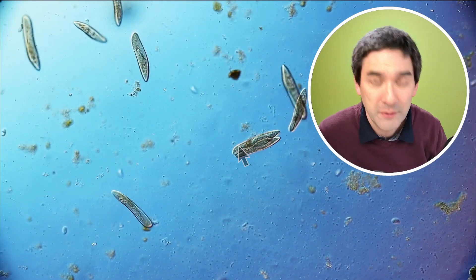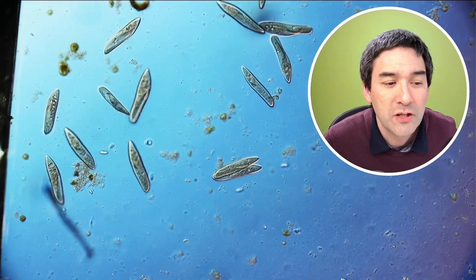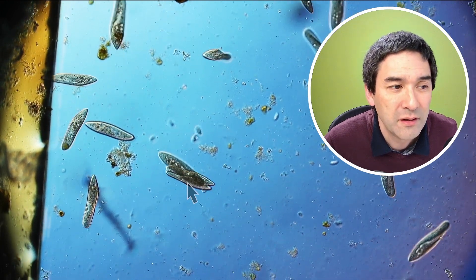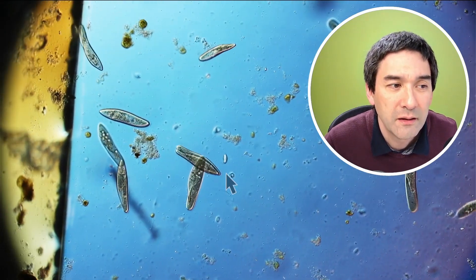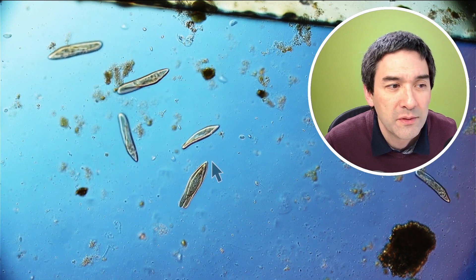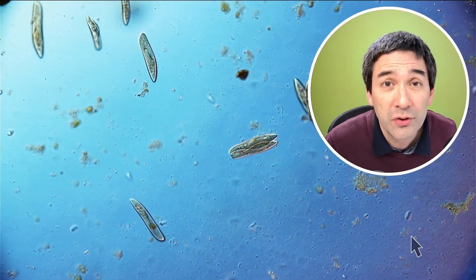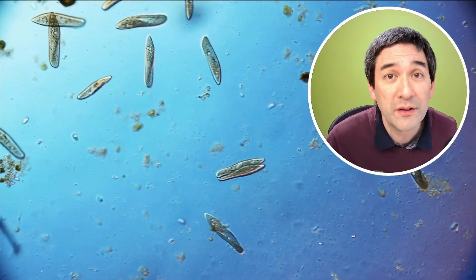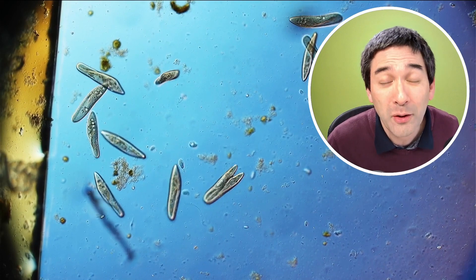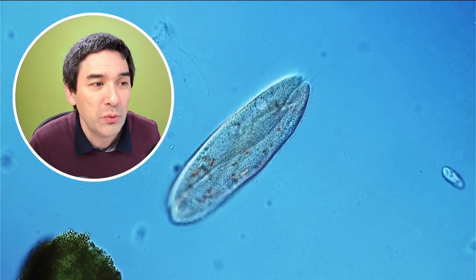Maybe you have already seen them — two of them actually started to pair up. You see those here? You see the two of them together. They're not dividing because they're in parallel, aligned lengthwise, and they're also fully grown already. What they're doing is they're conjugating. It happens quite frequently that when there are many cells around, they will start to line up this way and fuse together to exchange DNA. So this is essentially their method of overcoming the problem of having DNA that is always too similar. I would like to zoom in a little bit to show you what's going on.